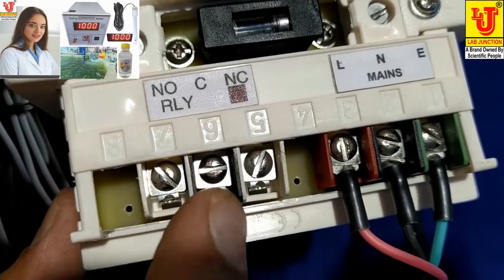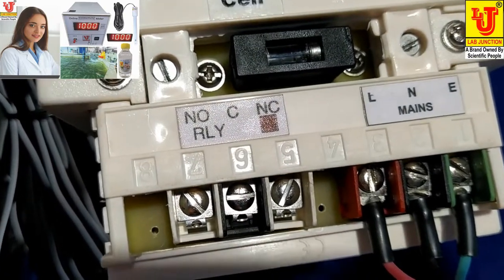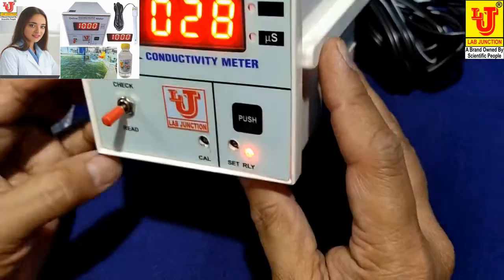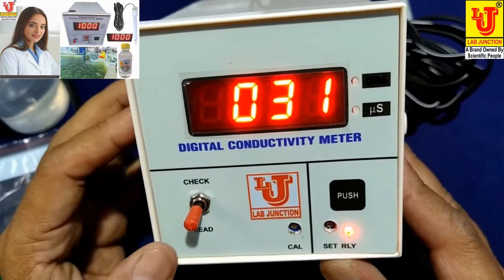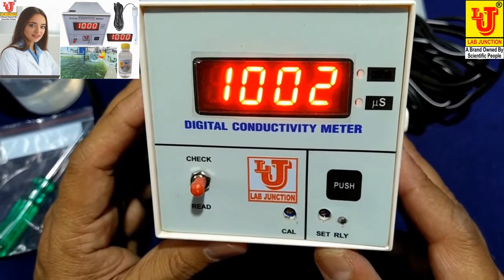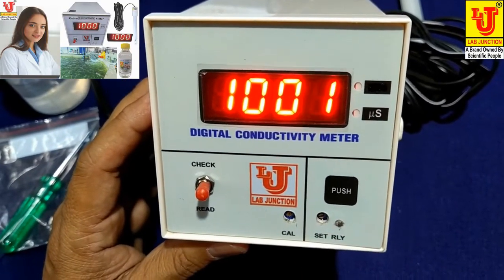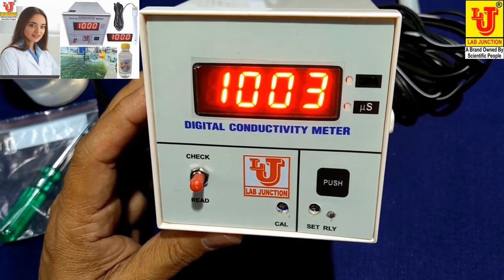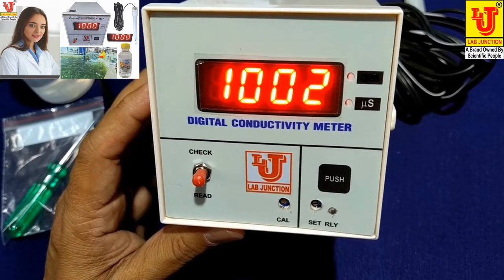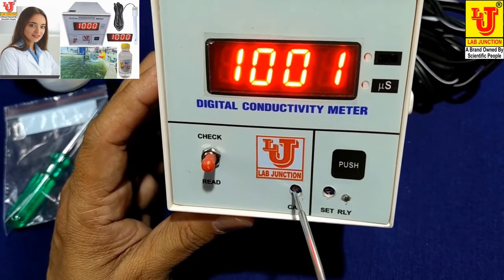These are the controls for relay set — you can set your relay buzzer or relay cut control from this instrument. This is the front view of the instrument. First, you have to check that 1.000 is displayed; if it does not come, then set it from the control just like this.